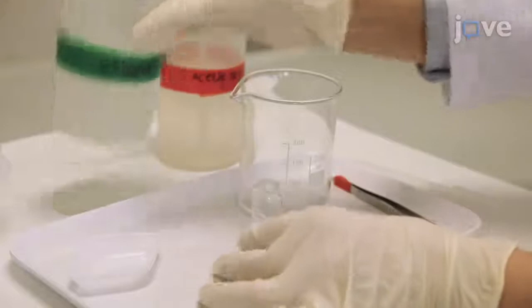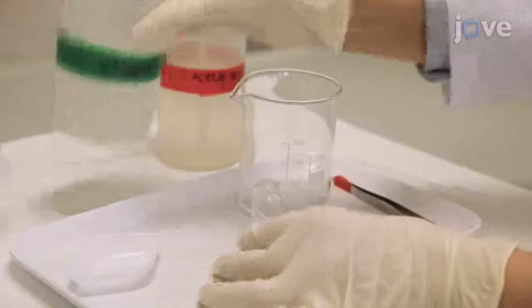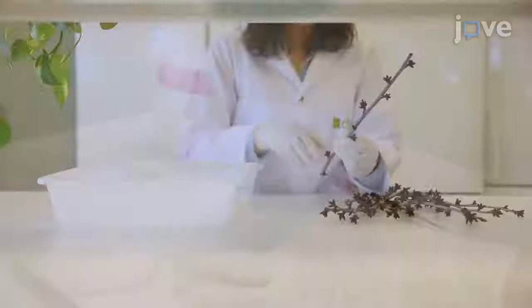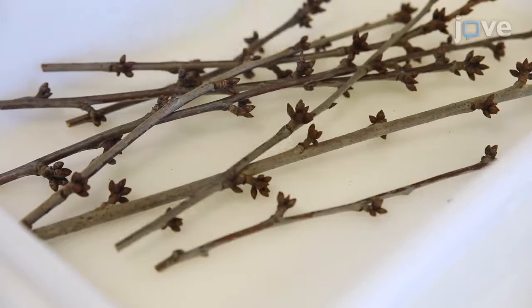After this, discard the fixative and add enough 75% ethanol to cover the samples. Obtain three shoots that are 15 to 30 centimeters in length and 5 millimeters in diameter with 10 flower buds each.